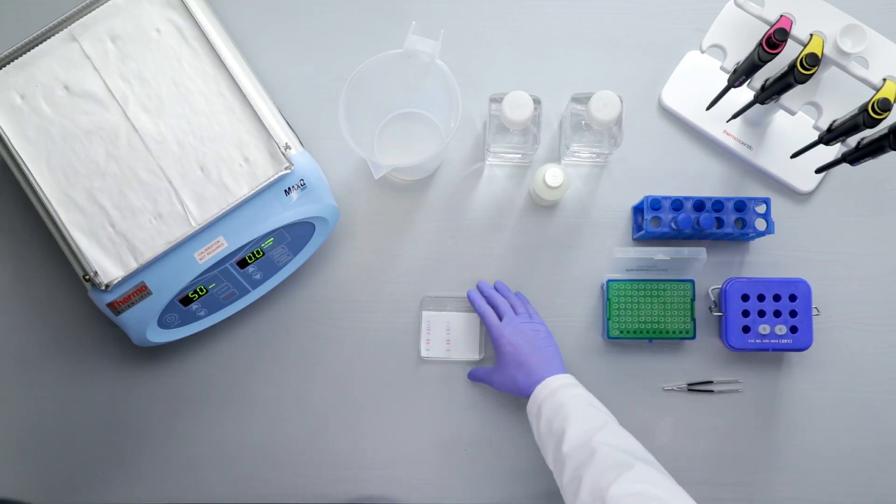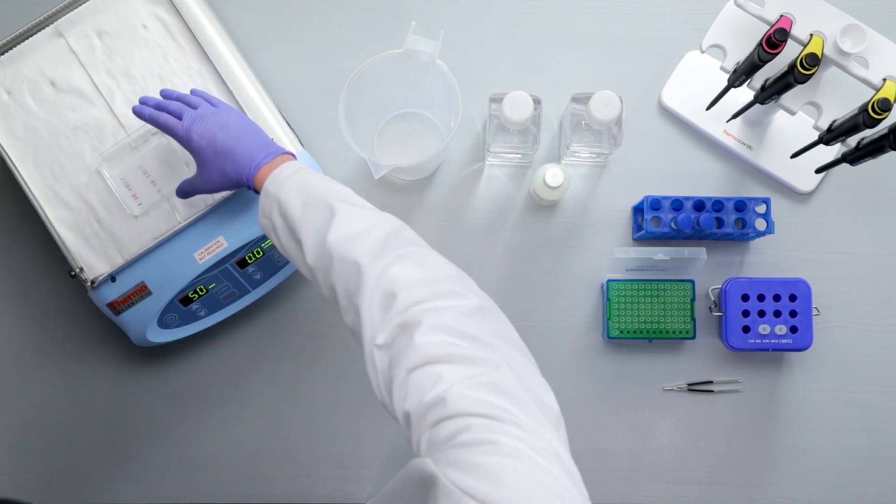Incubate the membrane with gentle agitation for 1 hour at room temperature, or overnight at 4 degrees Celsius.